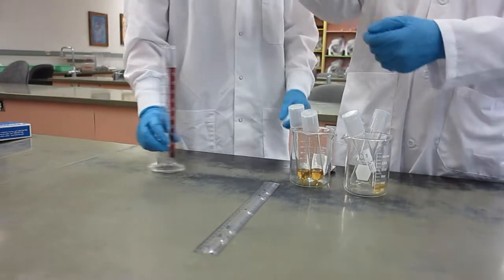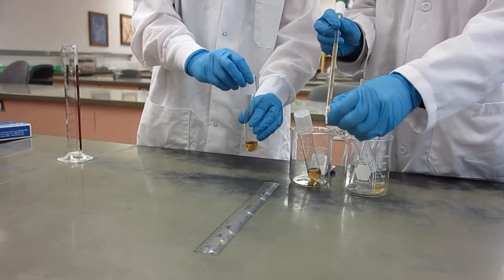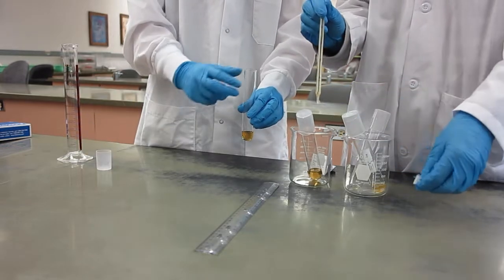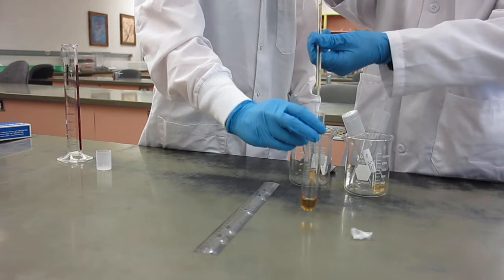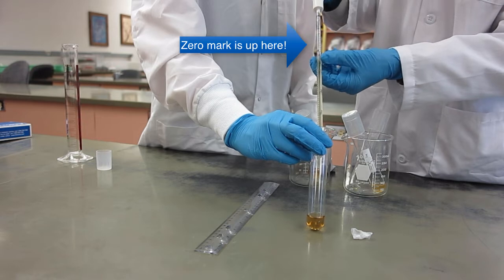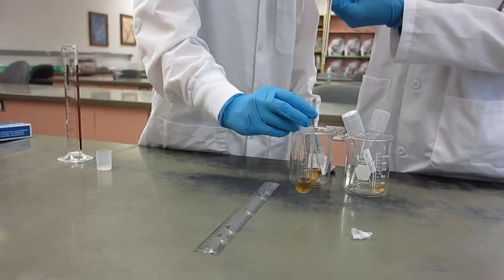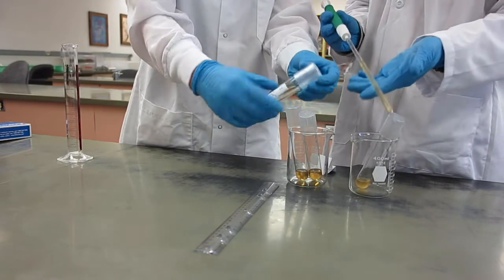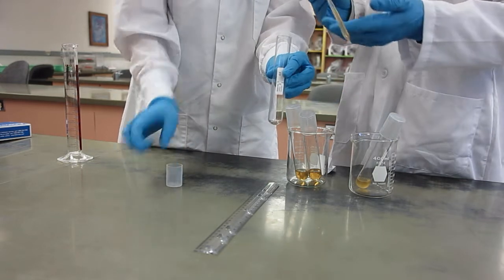Then, transfer the bottom ½ milliliter to the new culture tube. Make sure to keep track of the labels as you go. Start by looking at the 0 milliliter mark on the pipette and release liquid until it has gone down ½ milliliter. Return the remaining 4½ milliliters to the original tube, making sure to pay attention to the labels as you go.